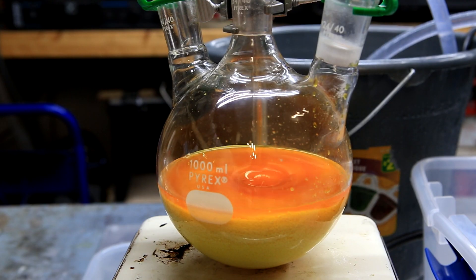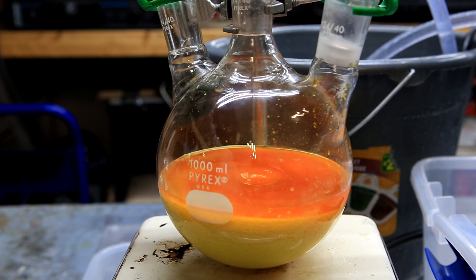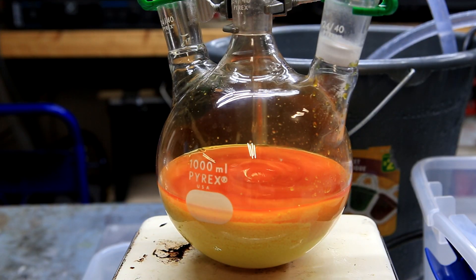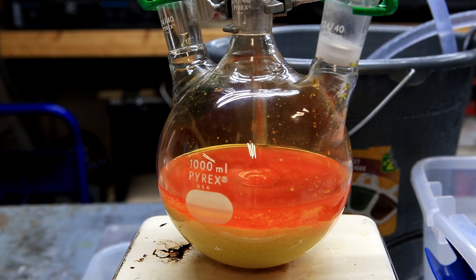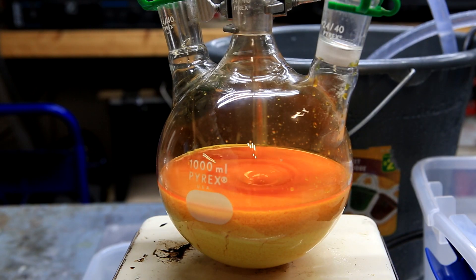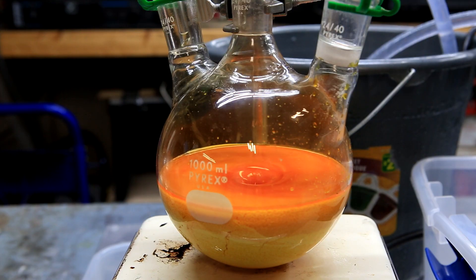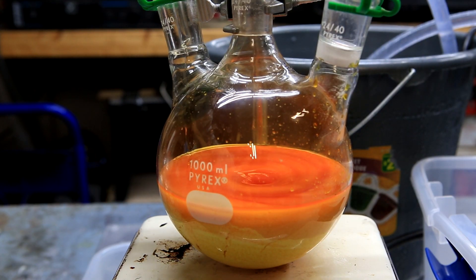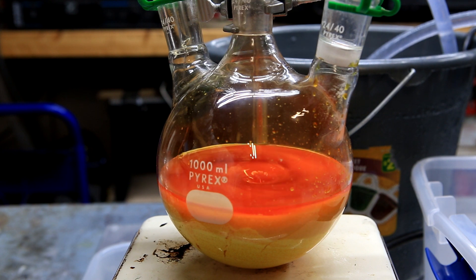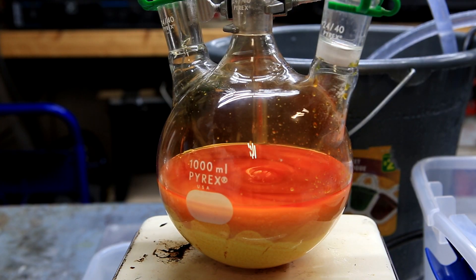With strong stirring, the hydrochloric acid is then added dropwise. I was able to add it in a closed system because I have an addition funnel, but if you don't, you can also simply pour in the hydrochloric acid and then quickly stopper it. The addition of the HCl is not exothermic to any real degree, so adding it quickly is not a hazard. I added the HCl slowly to keep the concentration low and prevent the formation of HCl vapors that could contaminate the bromine product. However, even if you add it quickly, it probably won't contaminate your bromine product to any significant degree.